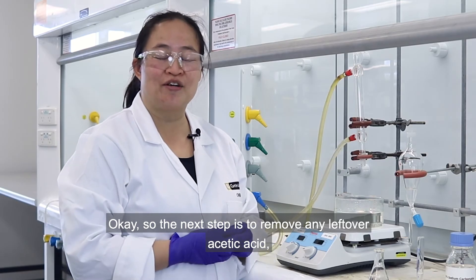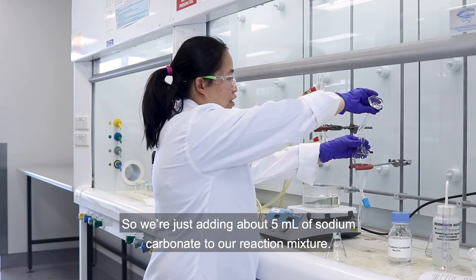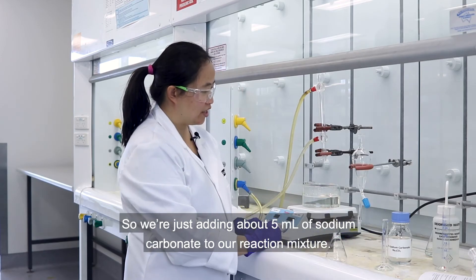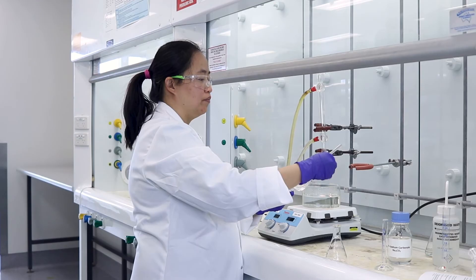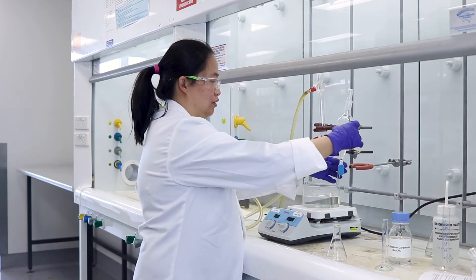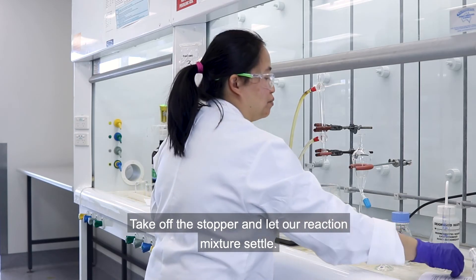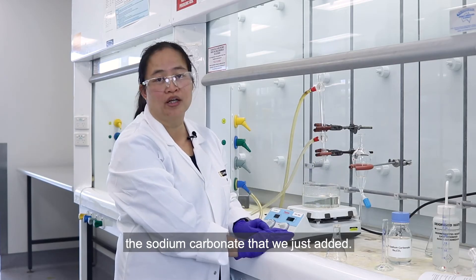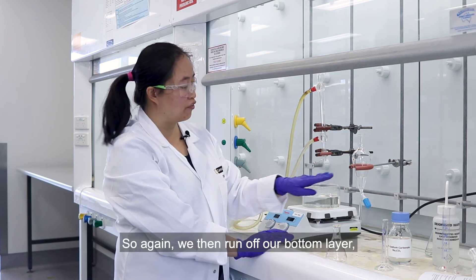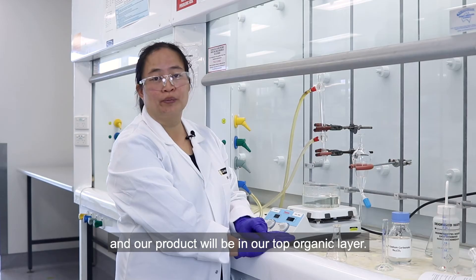The next step is to remove any leftover acetic acid or sulfuric acid that may be present. So we're adding about 5 ml of sodium carbonate to our reaction mixture. Invert, release pressure straight away, and shake. We'll take off the stopper and let our reaction mixture settle. Any excess acid should have reacted with the sodium carbonate we just added. We then run off our bottom layer, which is where the sodium carbonate and any excess acid will be, and our product will be in our top organic layer.